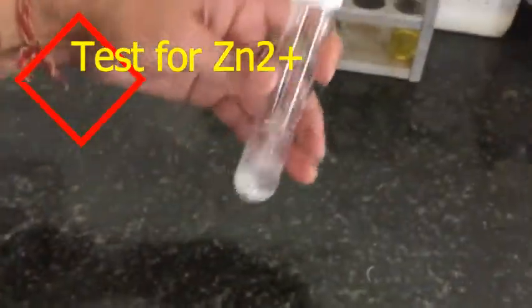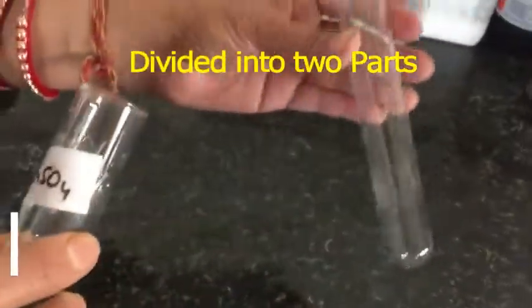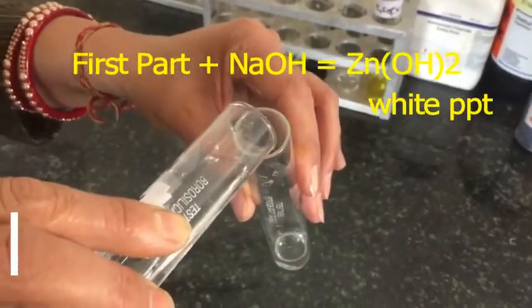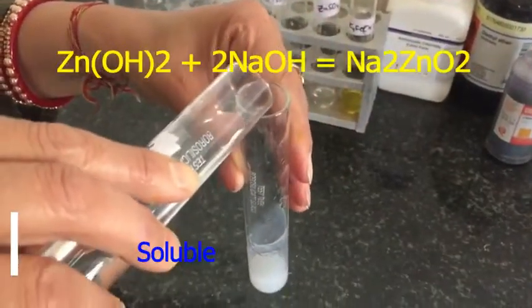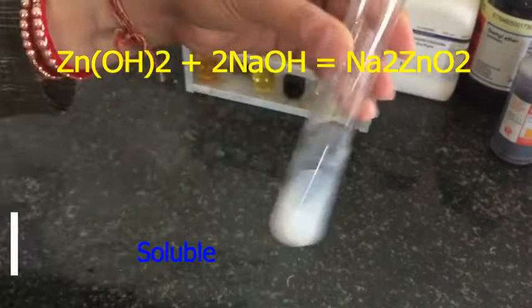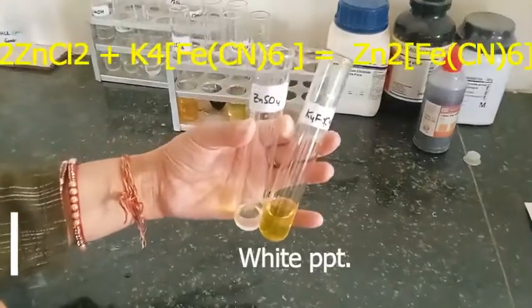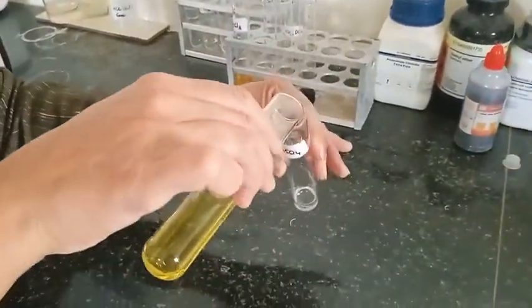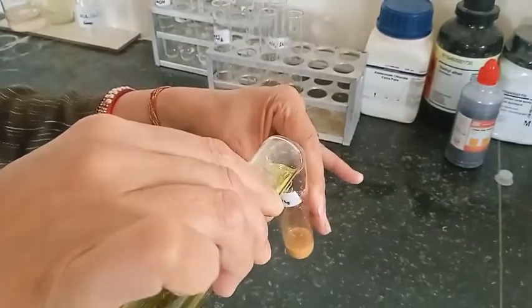Confirmatory test for zinc 2+ ions. We prepare the original solution with distilled water and divide it into two parts. To the first part, adding sodium hydroxide (NaOH) forms zinc hydroxide as a white precipitate. On further adding excess sodium hydroxide to the zinc hydroxide, it forms Na2ZnO2, which is soluble. To the second part, adding potassium ferrocyanide gives a white precipitate of zinc ferrocyanide.